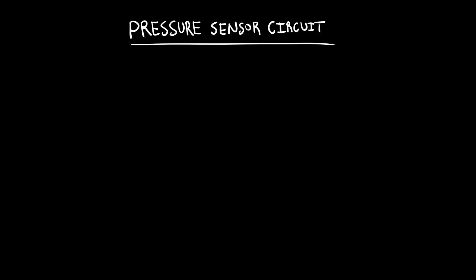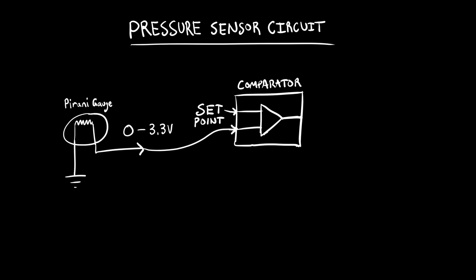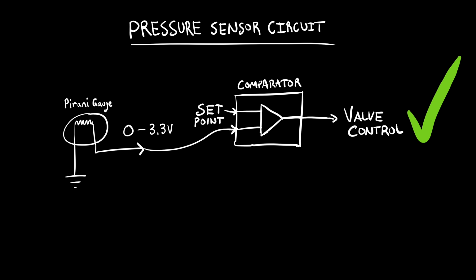Well, sort of. The pressure gauge outputs an analog voltage, which is compared with a set point voltage in order for the machine to operate.